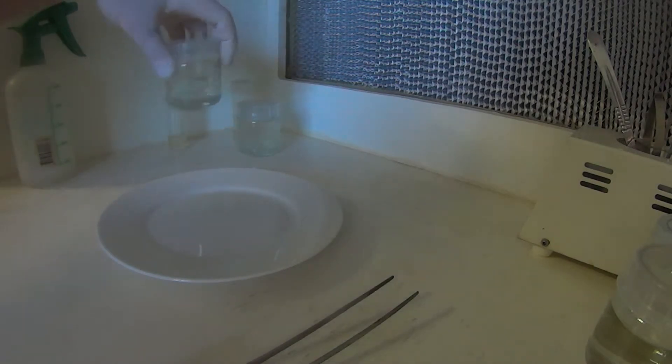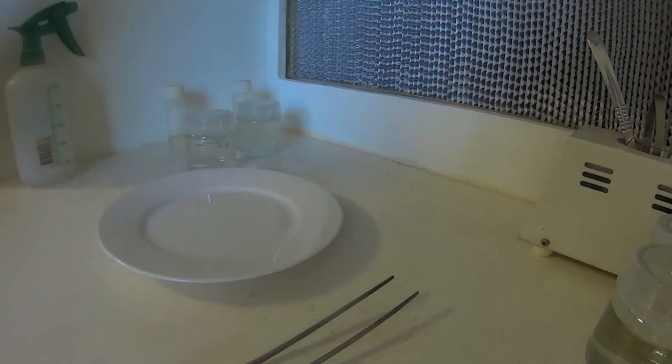I'll do this three times, obviously using fresh distilled water each time. So I'll just give that a few minutes soak and do it three times. And then we'll come back to it.